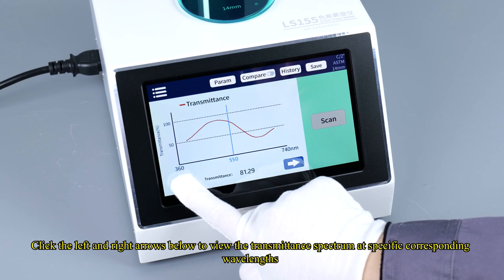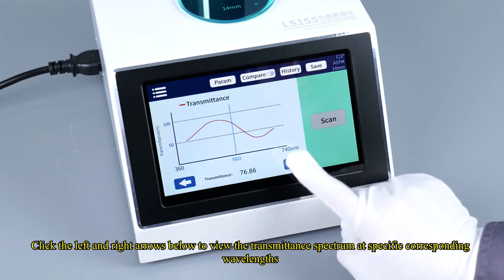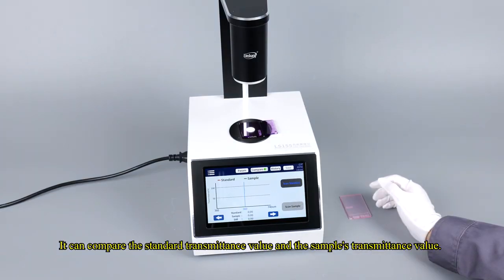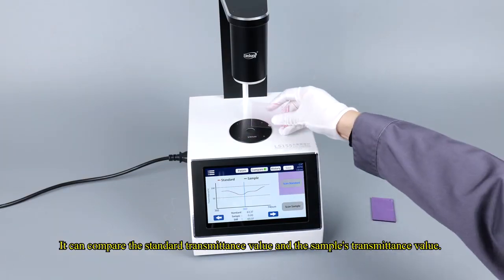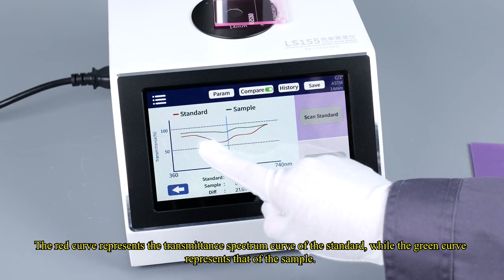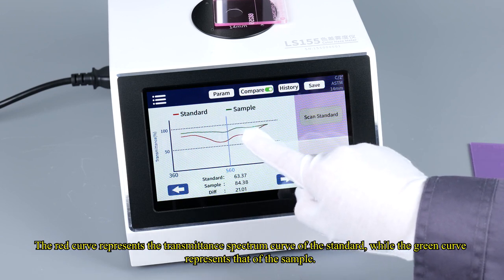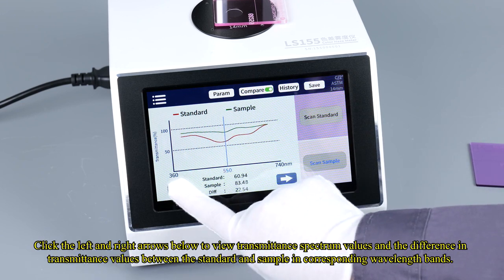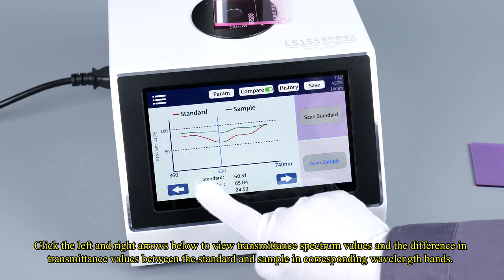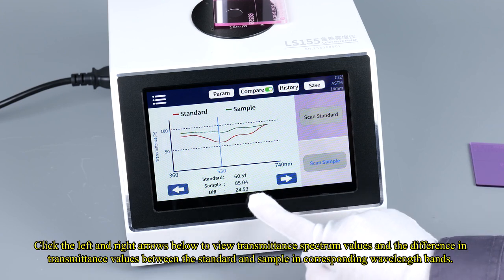Click the left and right arrows below to view the transmittance spectrum at specific corresponding wavelengths. Click Compare. It can compare the standard transmittance value and the sample's transmittance value. The red curve represents the transmittance spectrum curve of the standard, while the green curve represents that of the sample. Click the left and right arrows below to view transmittance spectrum values and the difference in transmittance values between the standard and sample in corresponding wavelength bands.